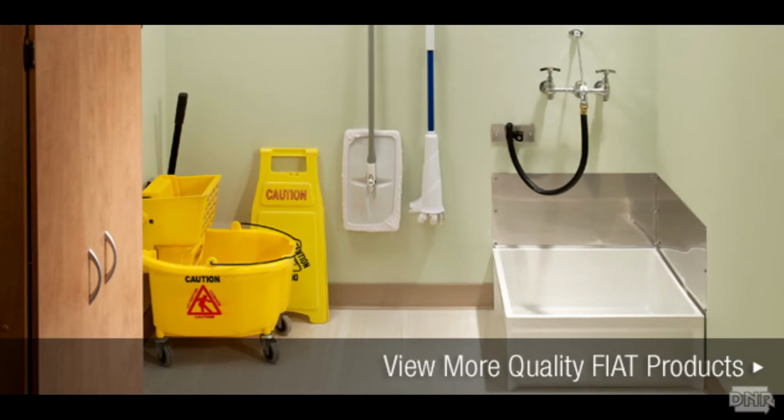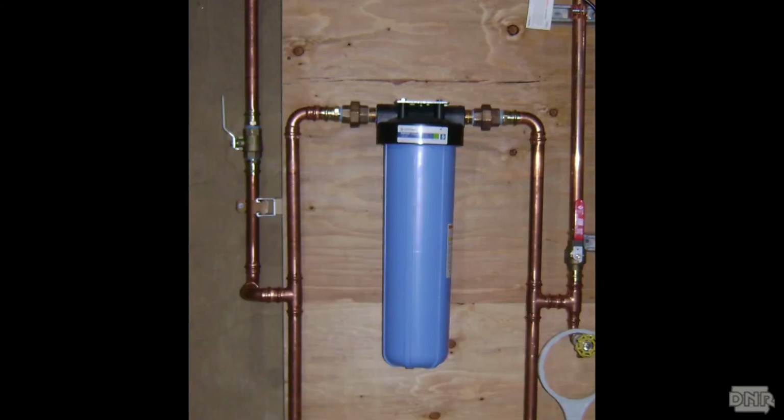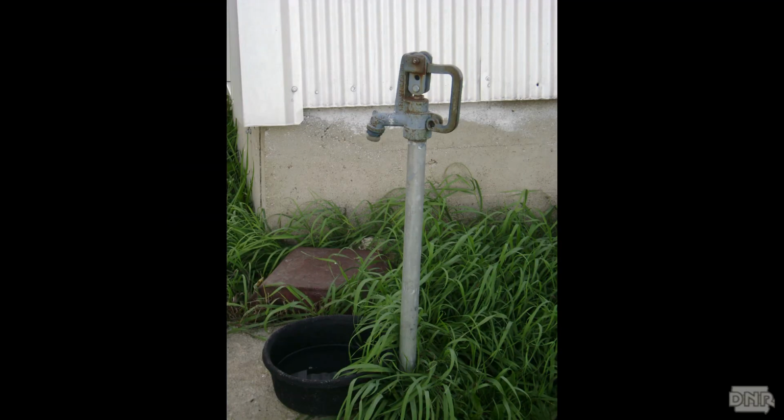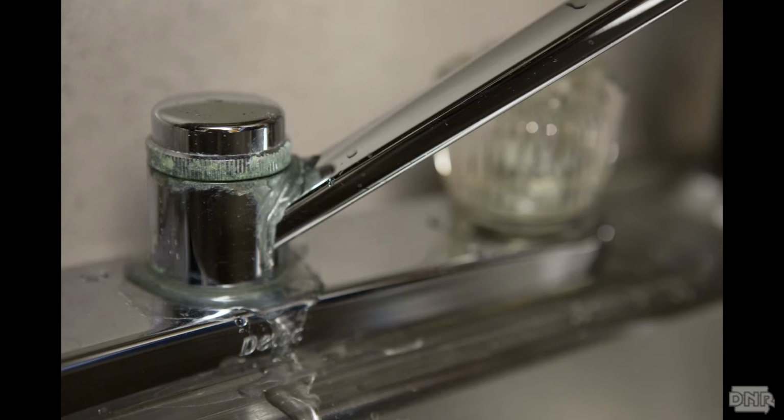Avoid collecting a sample from the following locations. Faucets with aerators, hose or sprayer or strainer attachments. Faucets that are connected to a water treatment device, such as a softener, filter, RO unit, UV light, or other in-home treatment units. Swivel or bar type or swing faucets. Frost proof hydrants, sprinkler systems for fire protection or meter pits. Fire hydrants, blow offs, or clean outs. Taps that are leaking at any point, cracked or worn, or otherwise in disrepair. Or taps that are dirty.